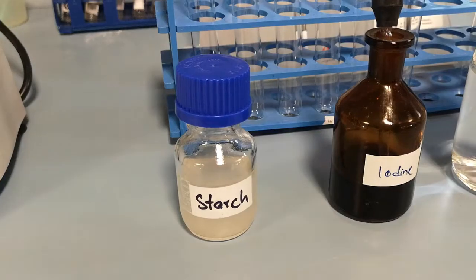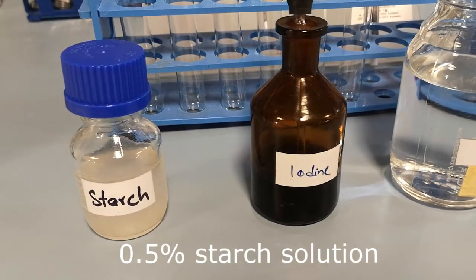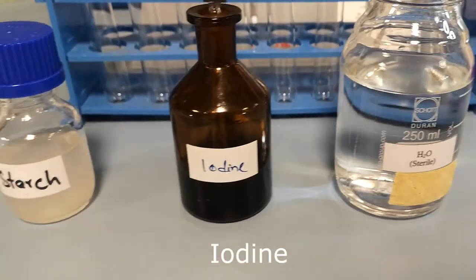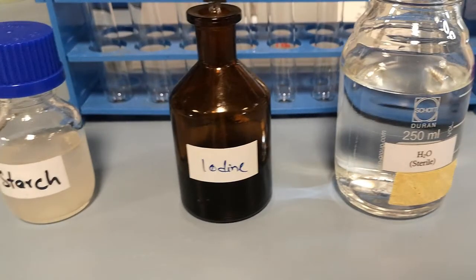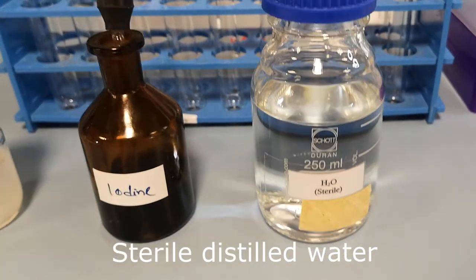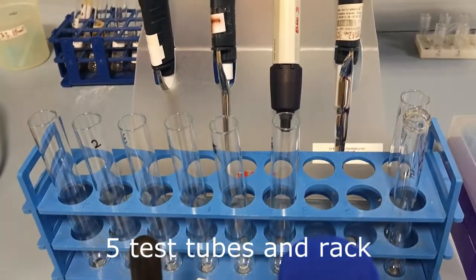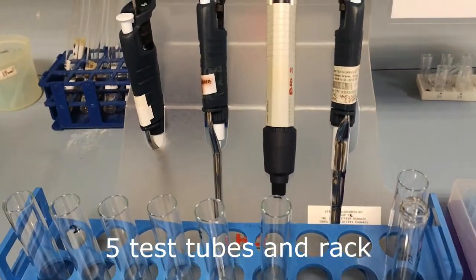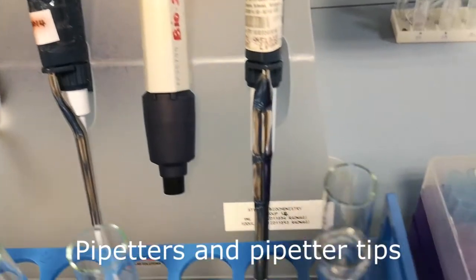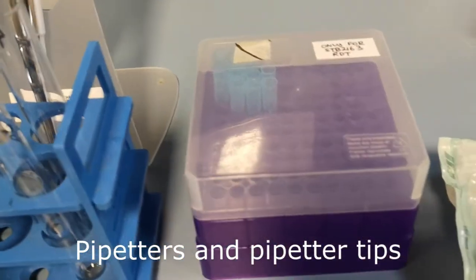In this experiment, you will need 0.5% starch solution, iodine, sterile distilled water, 5 test tubes and a test tube rack, pipetters, and pipetter tips.